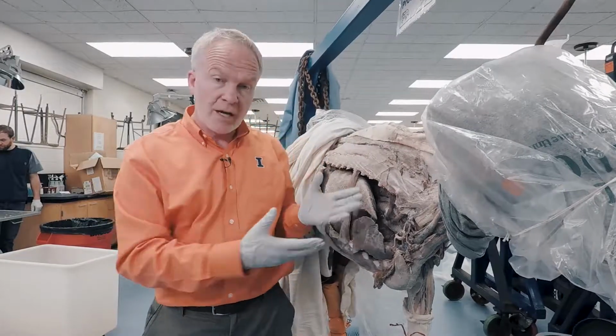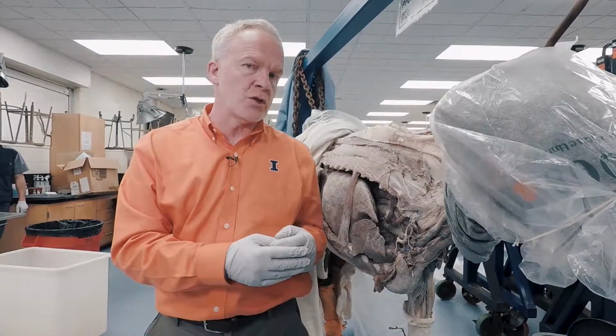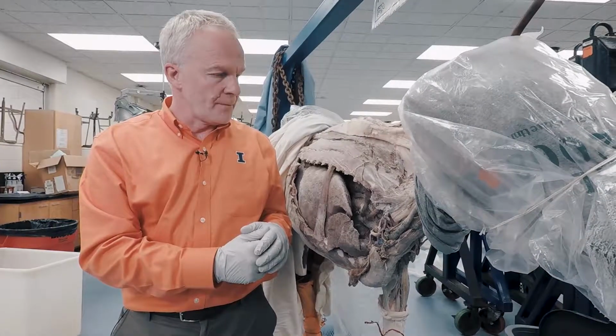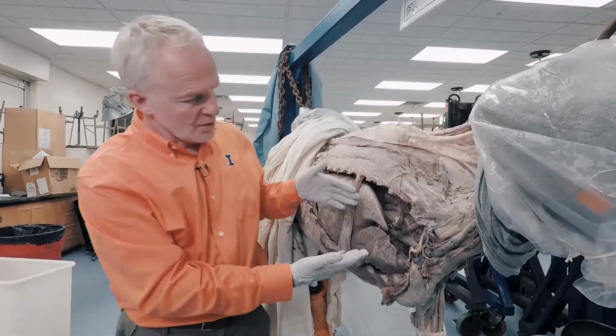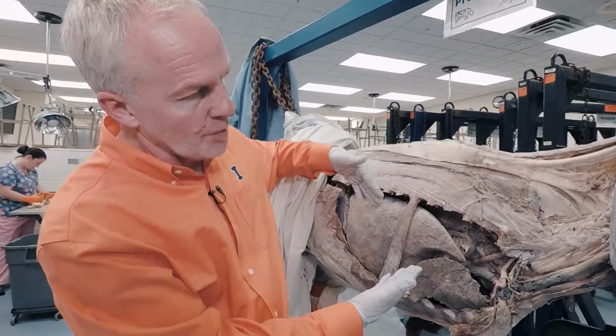So this is a bovine chest, and this animal has again been used for dissection, but it's used to demonstrate anatomy. So it's got a latex preservative used on it. So you can see that the veins are in blue, the arteries are in red on this animal, but the lung structure is actually very, very different than in the goat, and they have a different lobular structure.